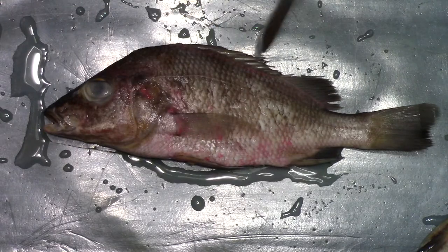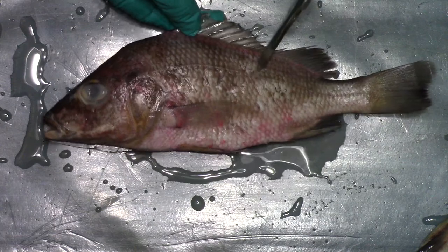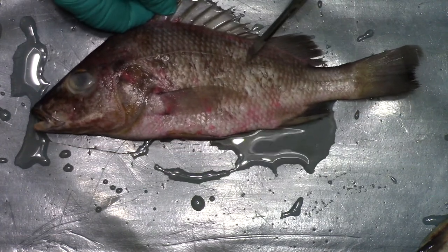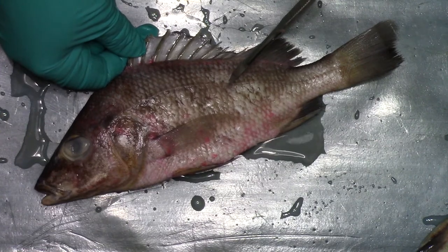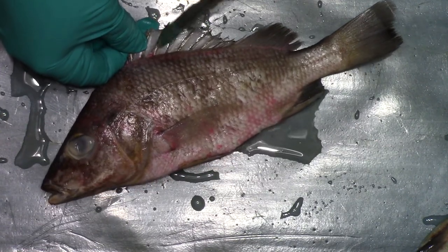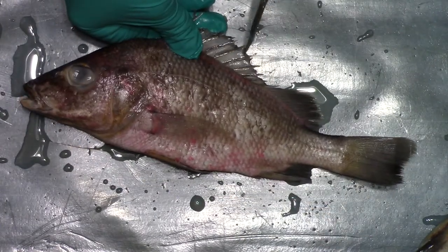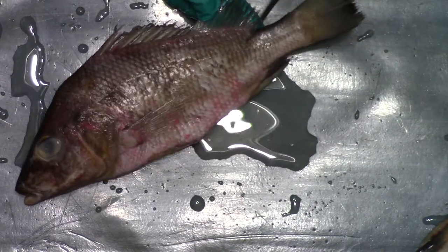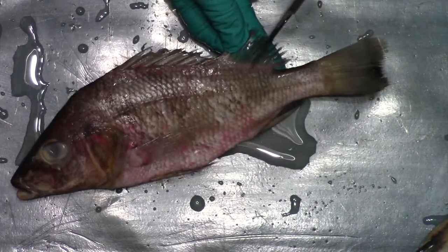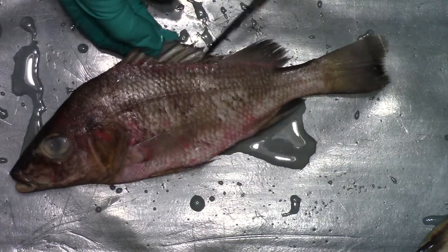This is really common — fish spines sort of fold flat, which means the whole fin folds flat. You can see that first, anterior dorsal fin is quite spiny. Whereas the second dorsal fin still has those spines, but they're not nearly as sharp or protruding.